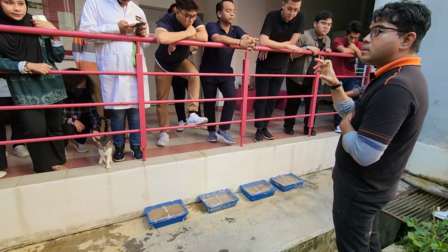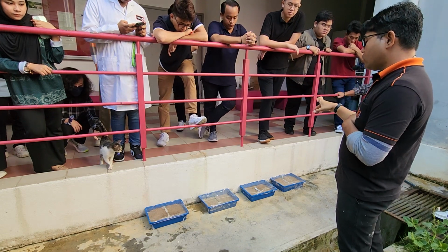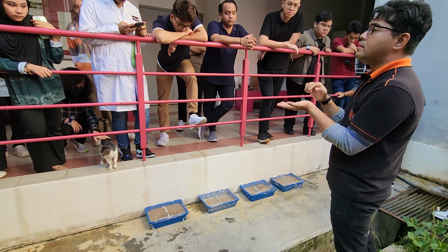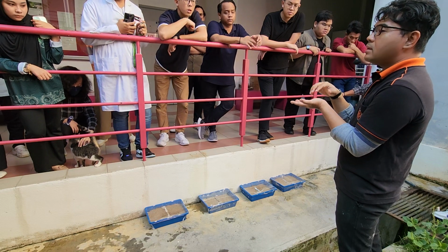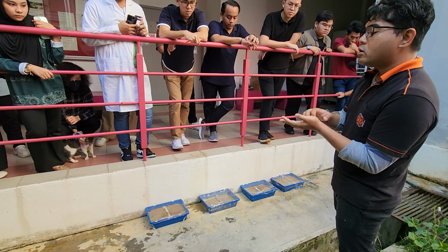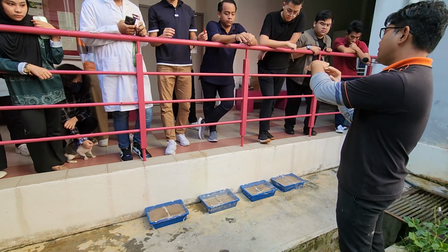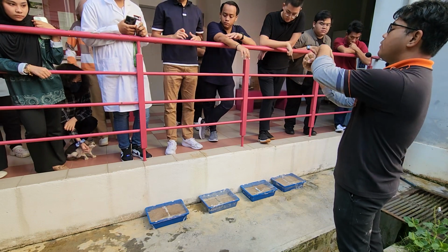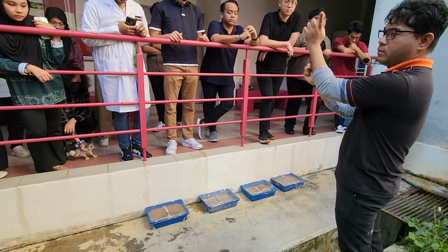Because it is common for our tropical area, if you expose the seeds without high humidity, that is going to cause seed desiccation, the drying of the seed surface. When that happens, the embryo can actually die, and we don't want that to happen. So we trap the moisture to increase the humidity, so that the entirety of the seed surface is in contact with 100% water.